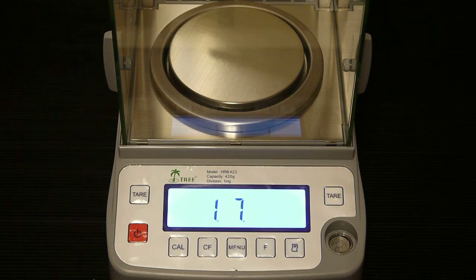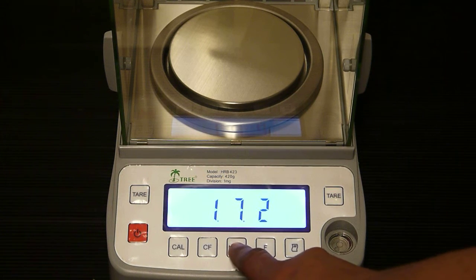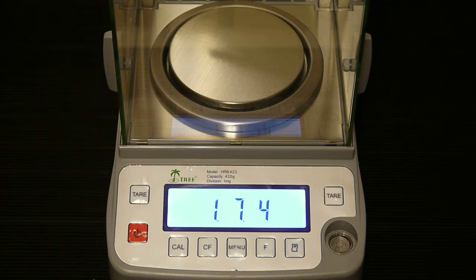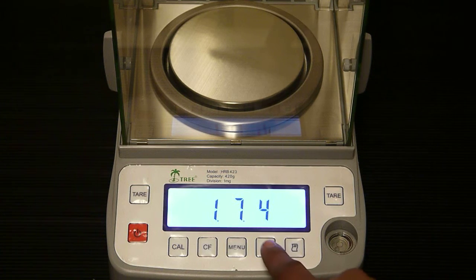And then the function key to move to the last digit. And again the menu key to increase the value of that digit. Now we want to press the function key to confirm the code.